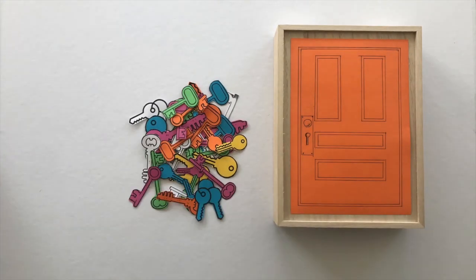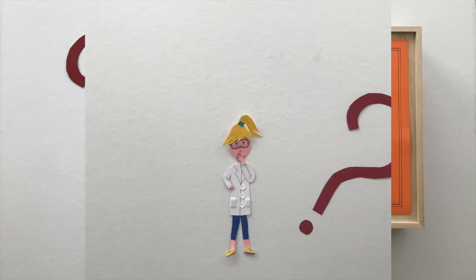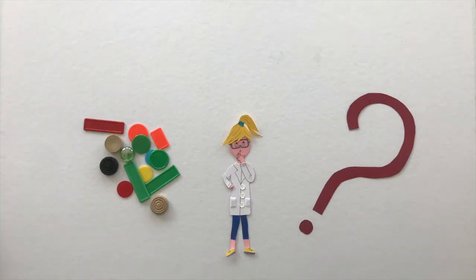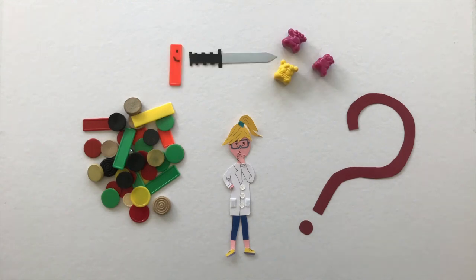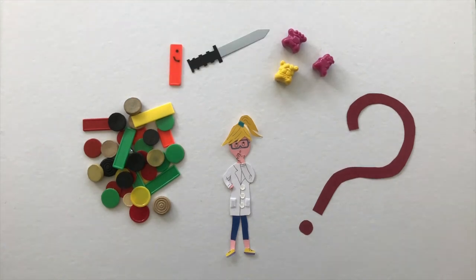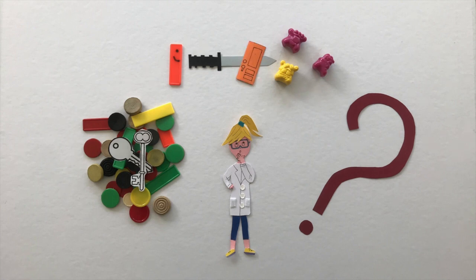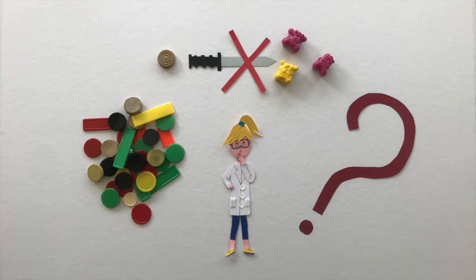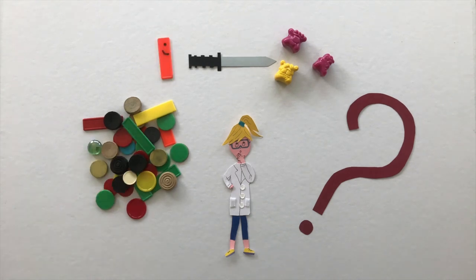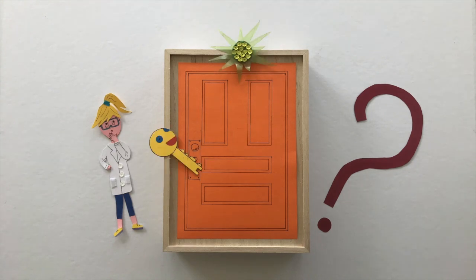Imagine a few million keys in front of you. Which one opens the door? Often researchers are faced with the same problem: a few million molecules and one goal. For example, the goal can be to find a molecule able to kill a bacterium. Molecules are like keys, and achieving the goal of killing bacteria is the door. To find the right one, we need to test all the molecules — this is like trying to open a door with all the keys.